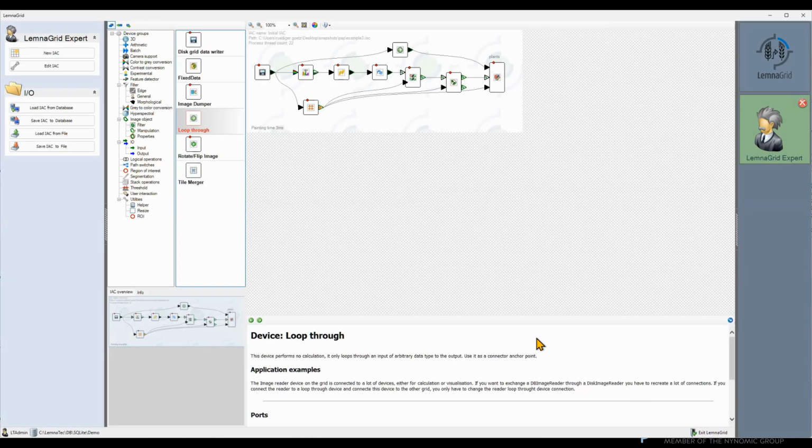There's a hidden message to this video. As we have seen, the analysis expects the plants at fixed positions. You define these positions as described in this video. If plants are at a different position, for instance, the plant tray is shifted to the right, the analysis may fail. It may misassign parts of the plant to another position. That said, a small jitter of a few pixels can be compensated as I demonstrated. Therefore, it is important to place your plants always the same way into your system.